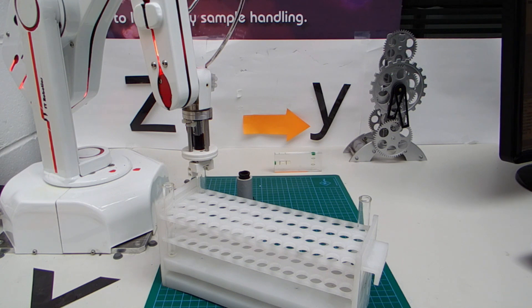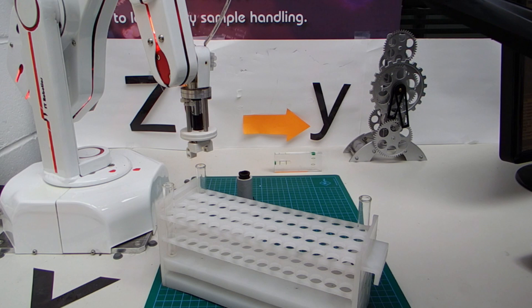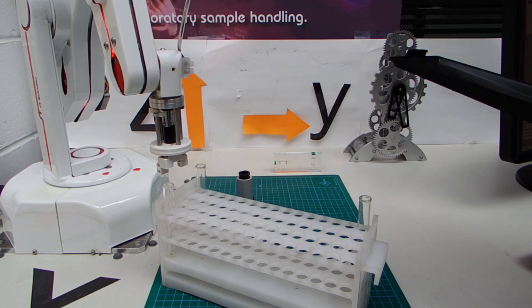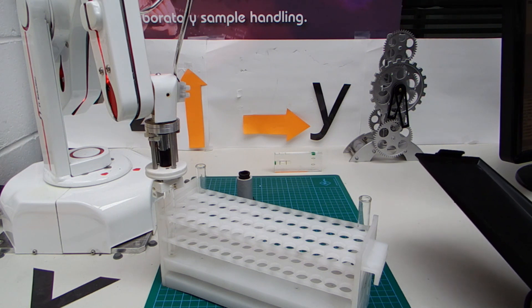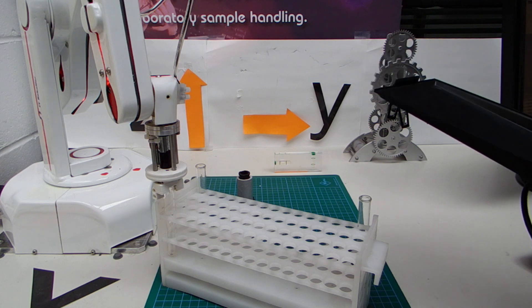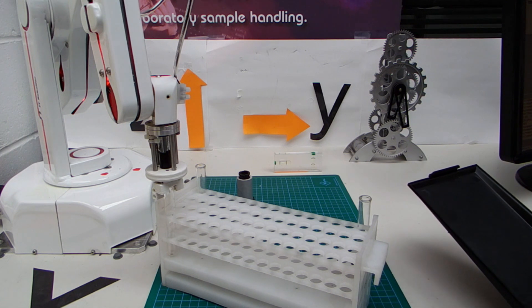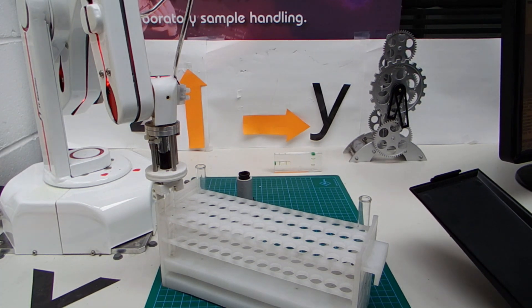Selecting 25mm increments again, moving up on Z and across to the final corner, which is position 60. Switching to smaller increments, moving down a little bit more. I'll do a trial grip — that's okay. Back to the screen, and this time I click set to here on line 60. And then you click interpolate, which calculates all the in-between positions.